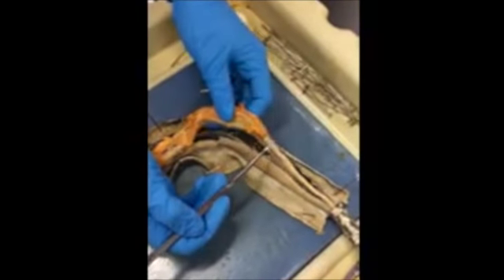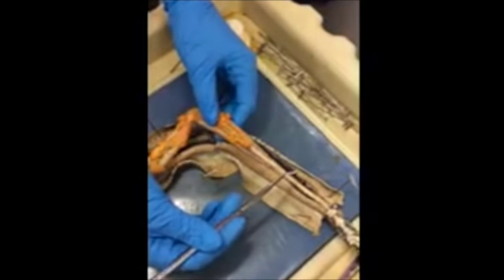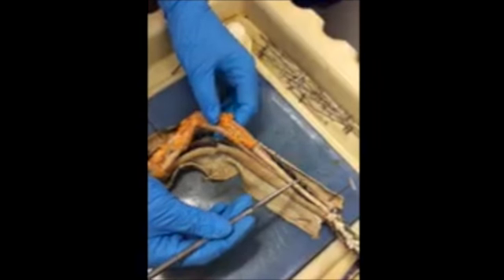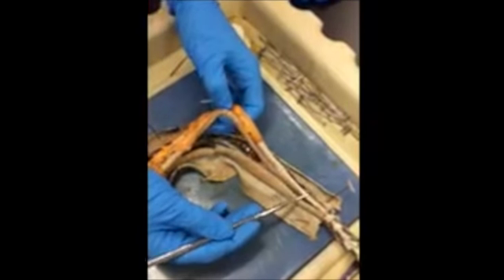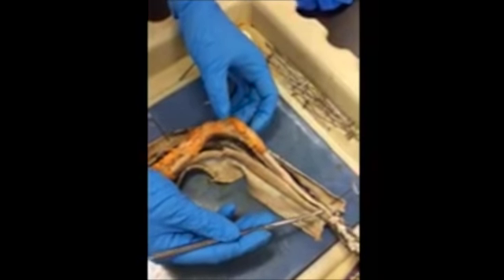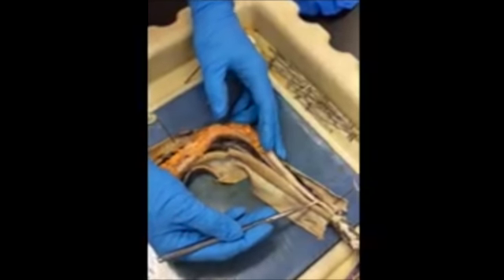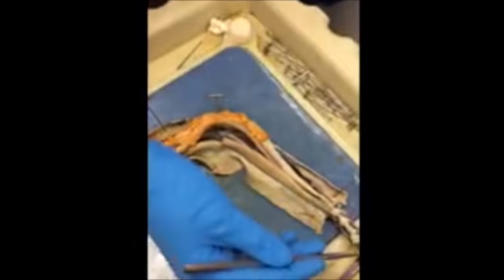The kidneys function in the removal of hydrophilic substances such as ions, water, and other nitrogen wastes. Snakes excrete a concentrated substance called uric acid that is white and thick. This concentrated waste is a mechanism for the conservation of water in the body.